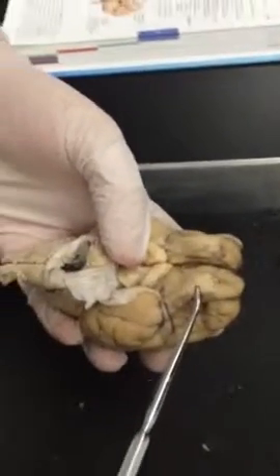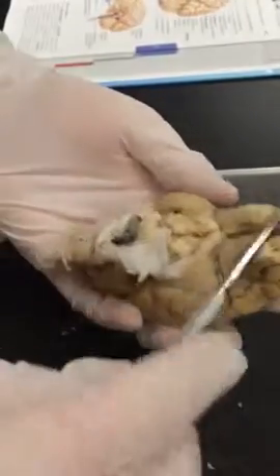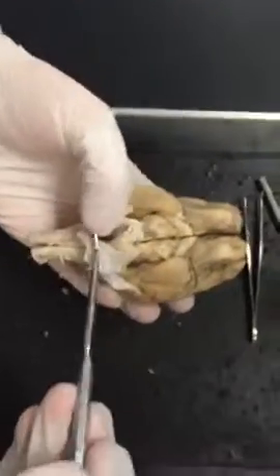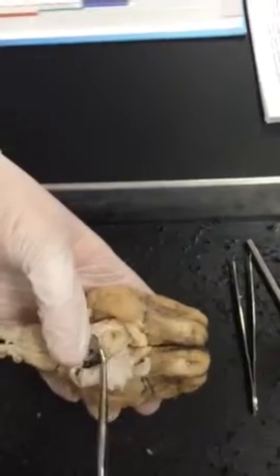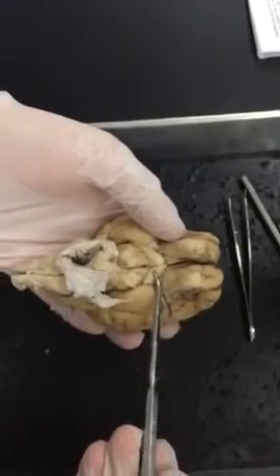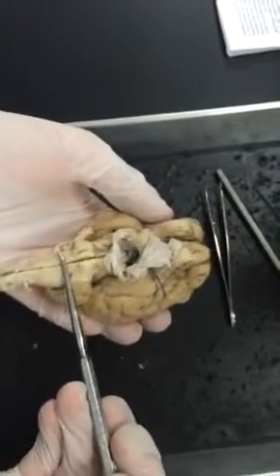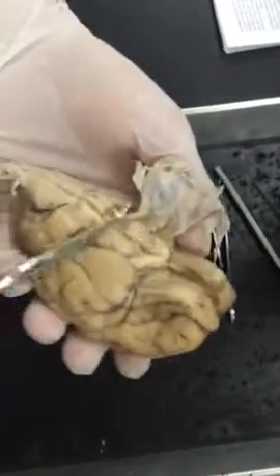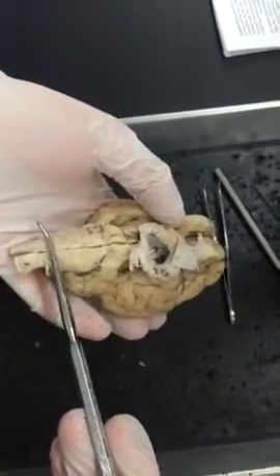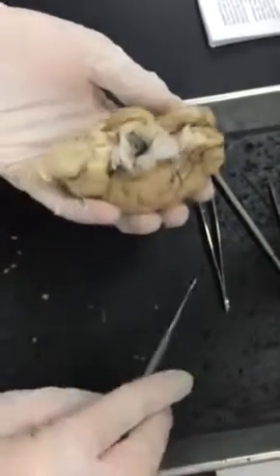So you have your olfactory bulbs, which then consist of the olfactory tract. You still have your lobes, and then right here you have your pituitary gland and the optic chiasma. If we move the pituitary gland a little bit, then we can identify what's known as the pons, and then you have another one which becomes the medulla oblongata, and then later on extends into your spinal cord.